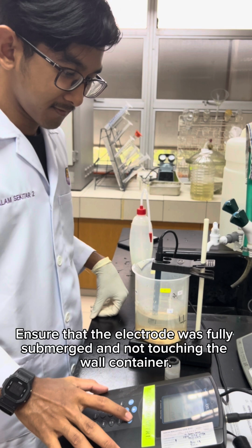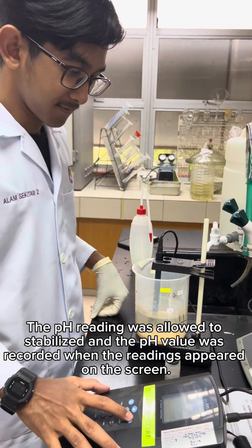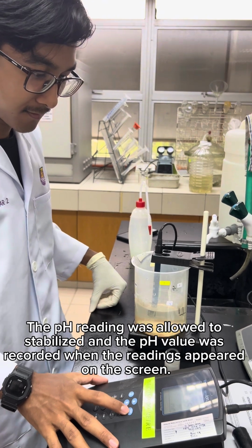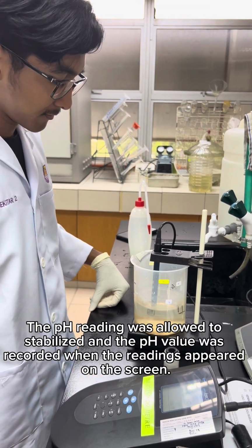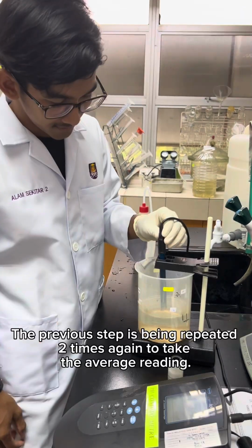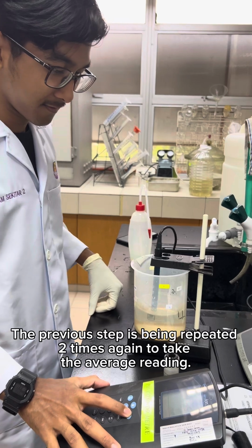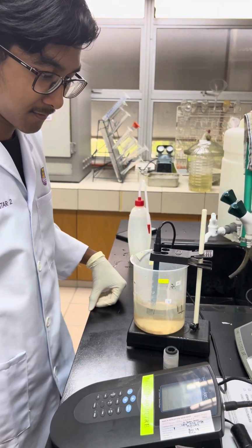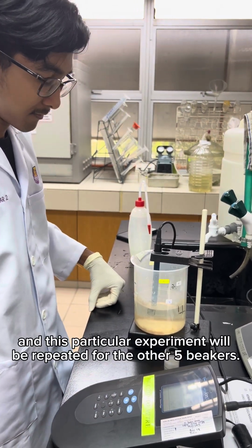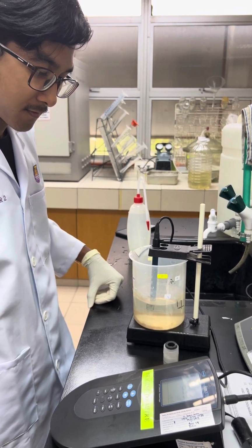Ensure that the electrode is fully submerged and not touching the walls of the container. The pH reading was allowed to stabilize, and the pH value was recorded when the reading appeared on the screen. The previous step is repeated two more times to take the average reading, and this experiment will be repeated for the other five beakers.